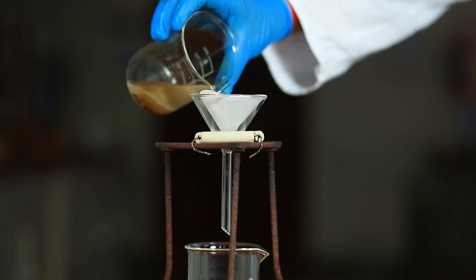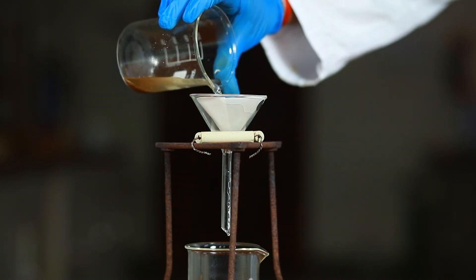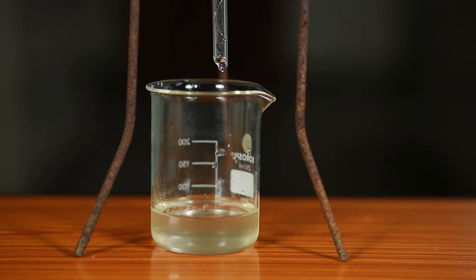Filter the content with the help of a funnel and filter paper. We observe that sand remains undissolved in water and is separated by the process of filtration.